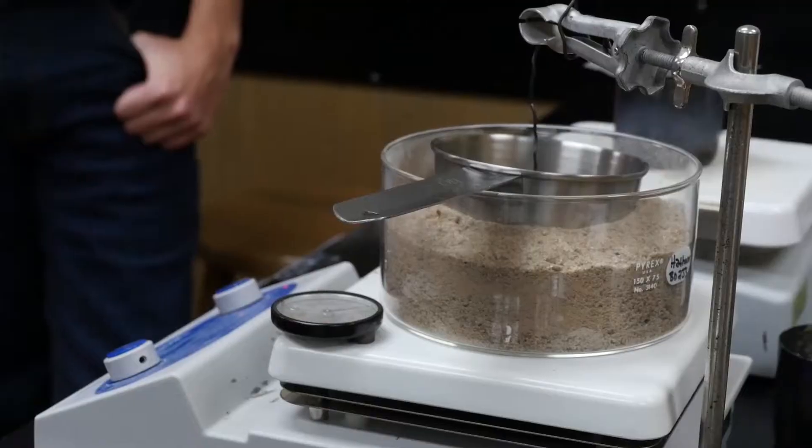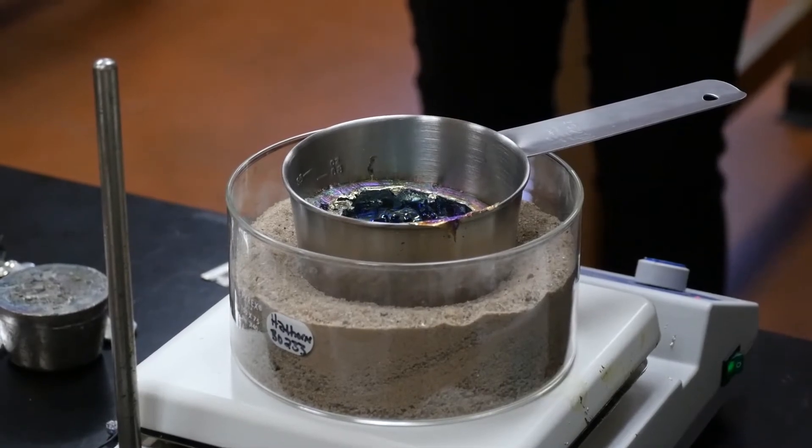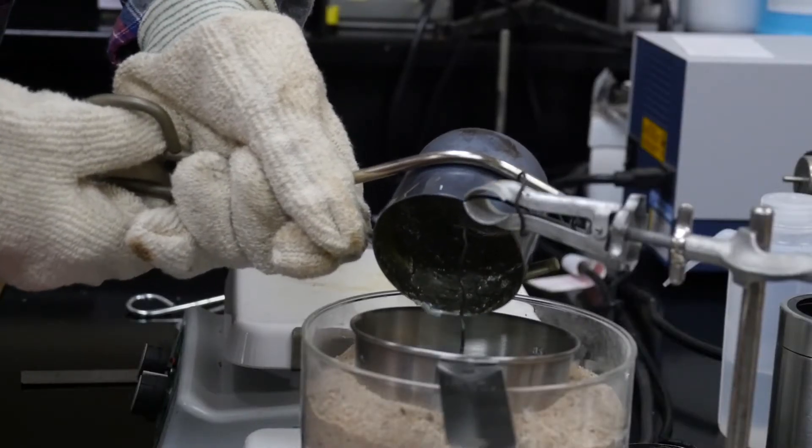And once that's nice and melted, we take it, pour it into another container, let it cool at about 180 degrees Celsius.